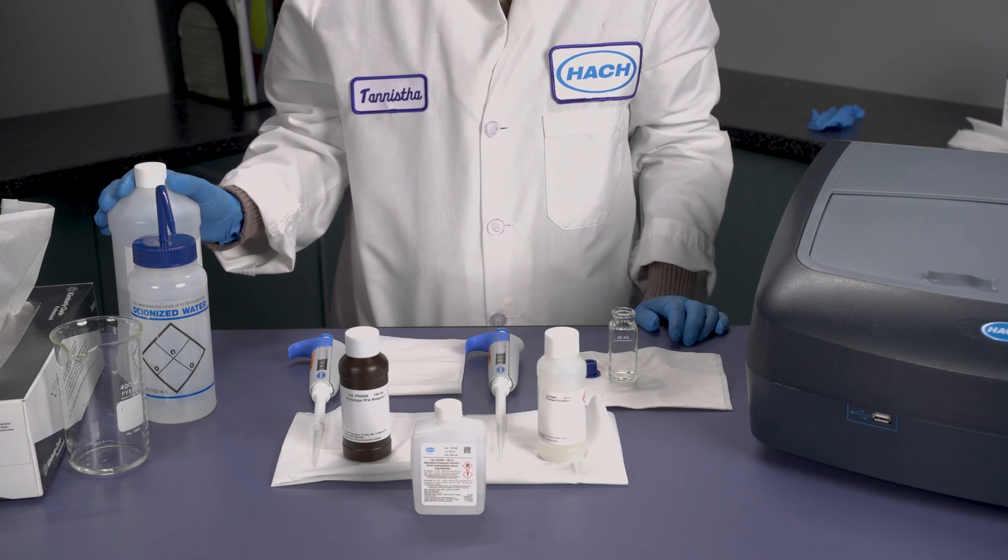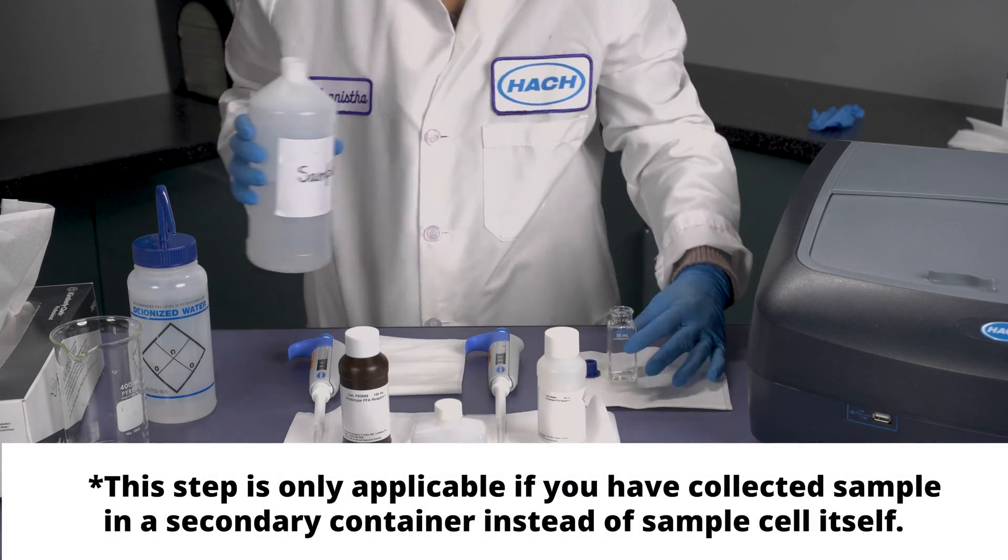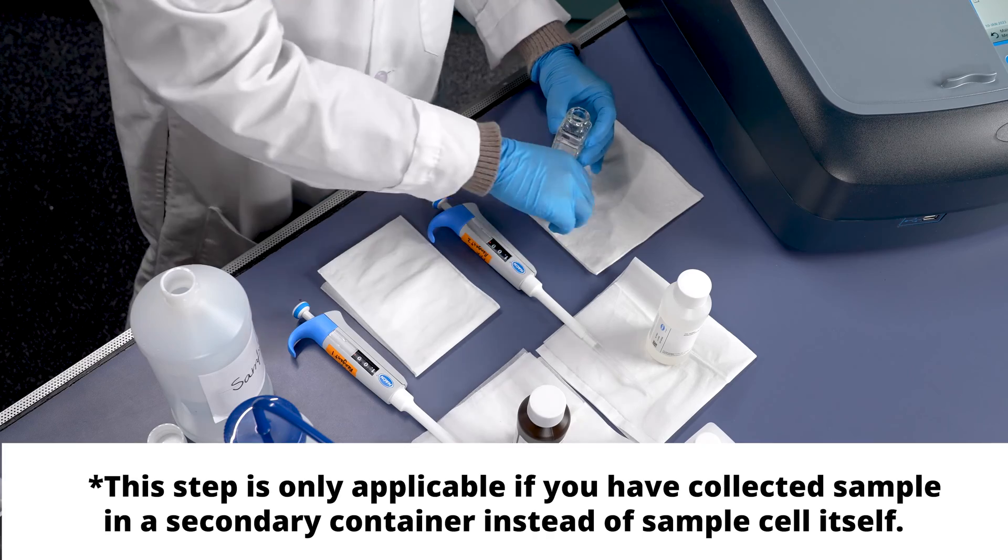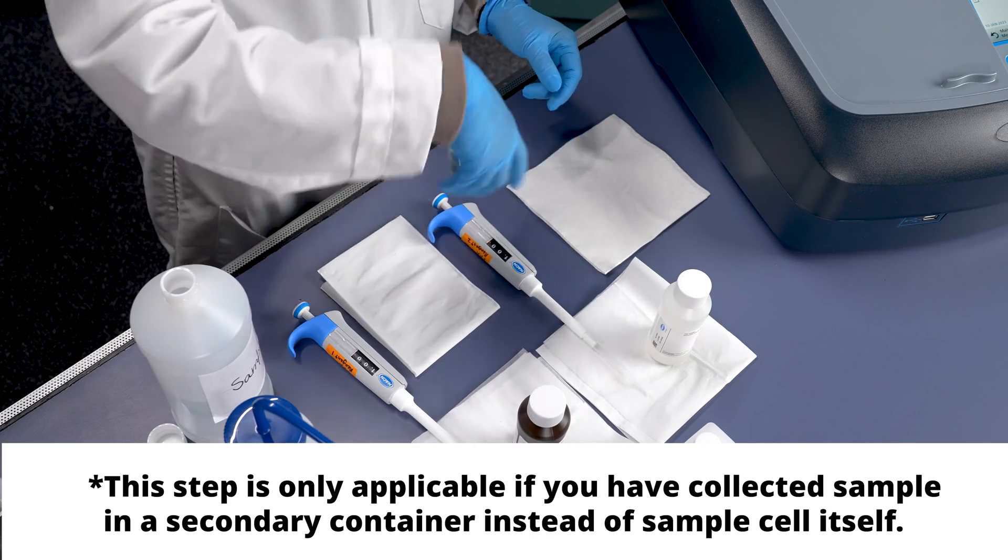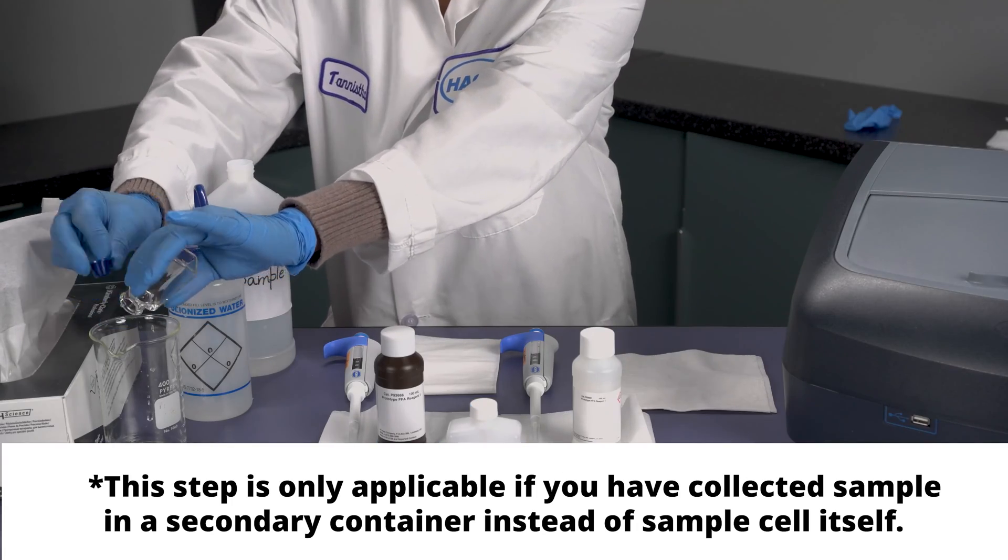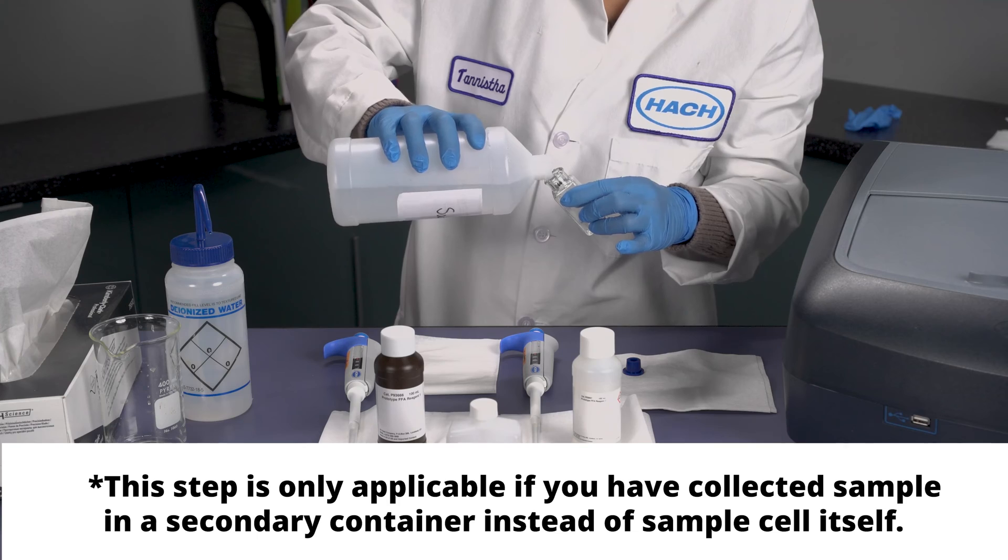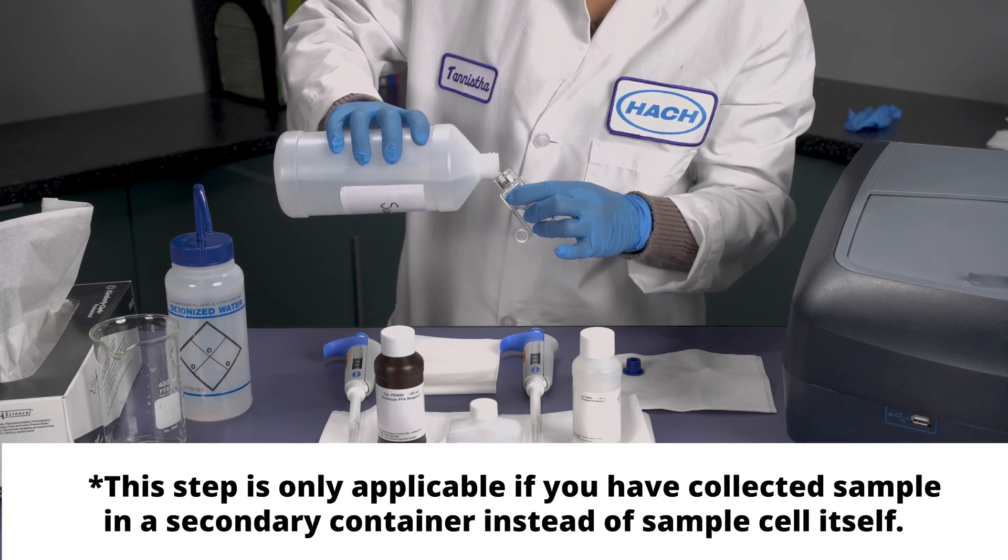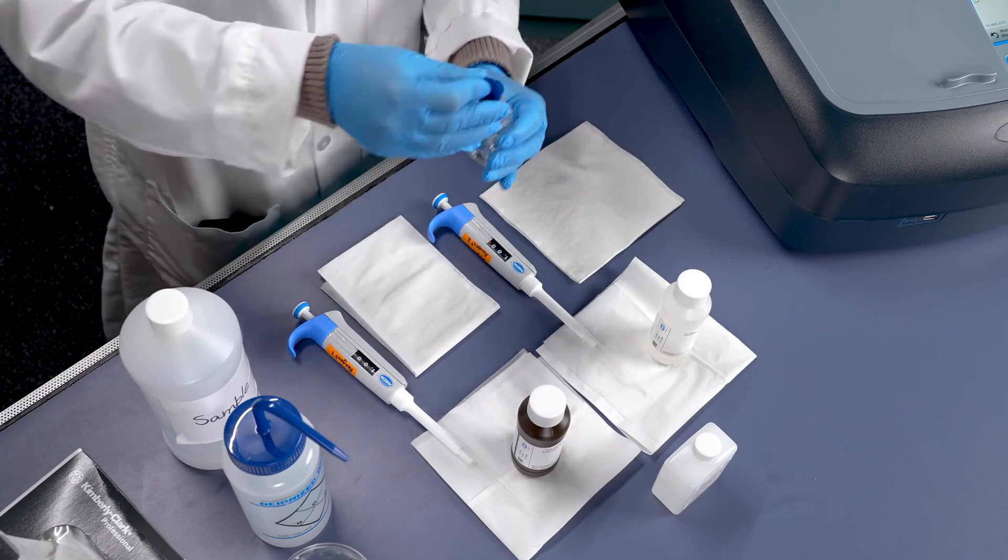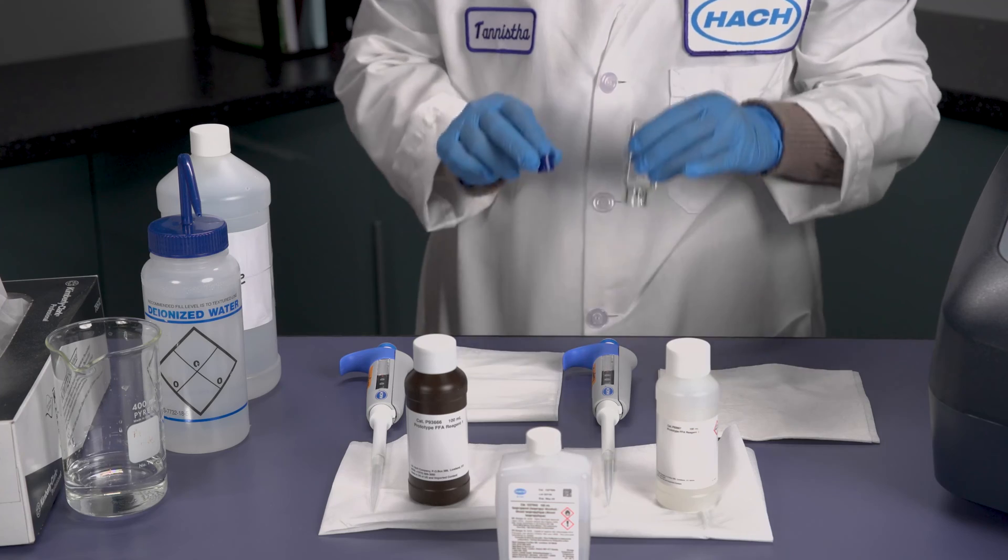Next, we're going to rinse out the sample cell twice with our sample. After your final rinse, it is very important to shake out all of the solution from the sample cell and the rubber cap to make sure you do not have cross-contamination.